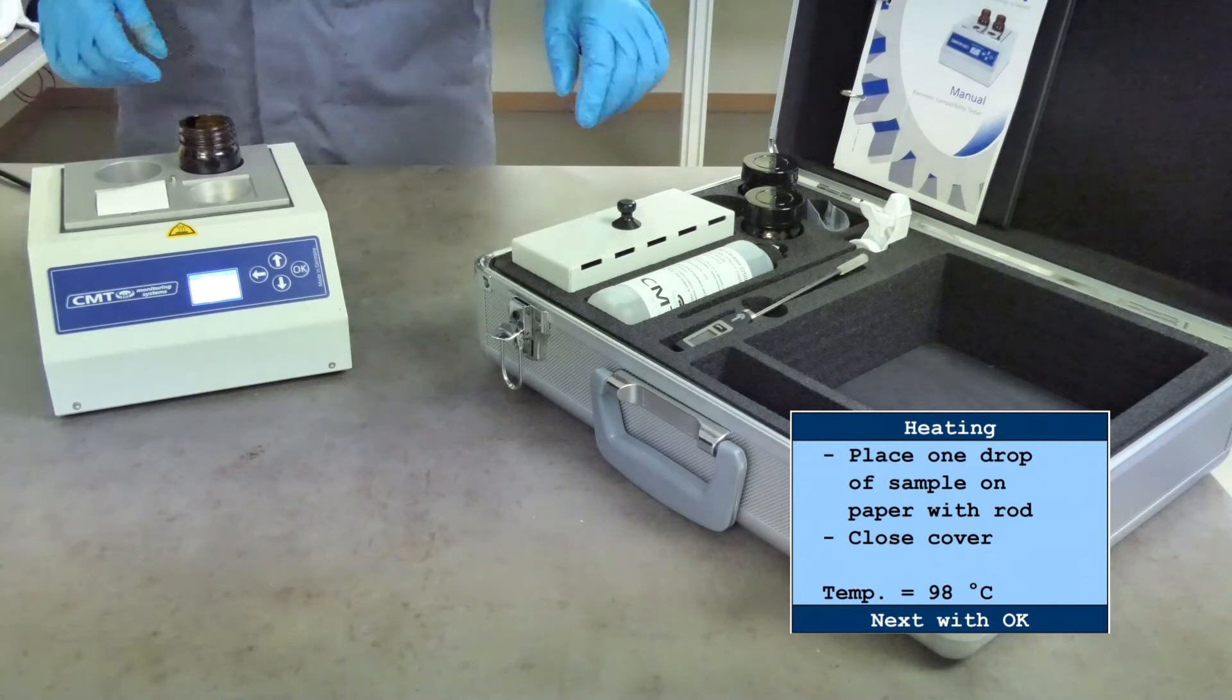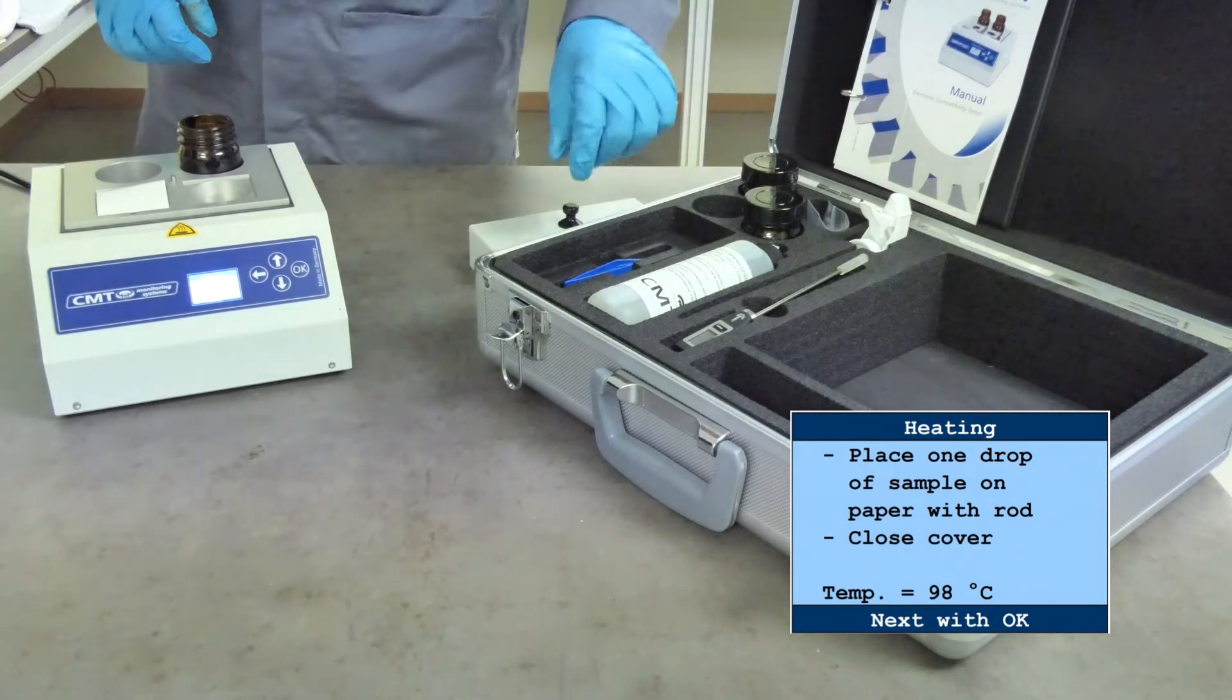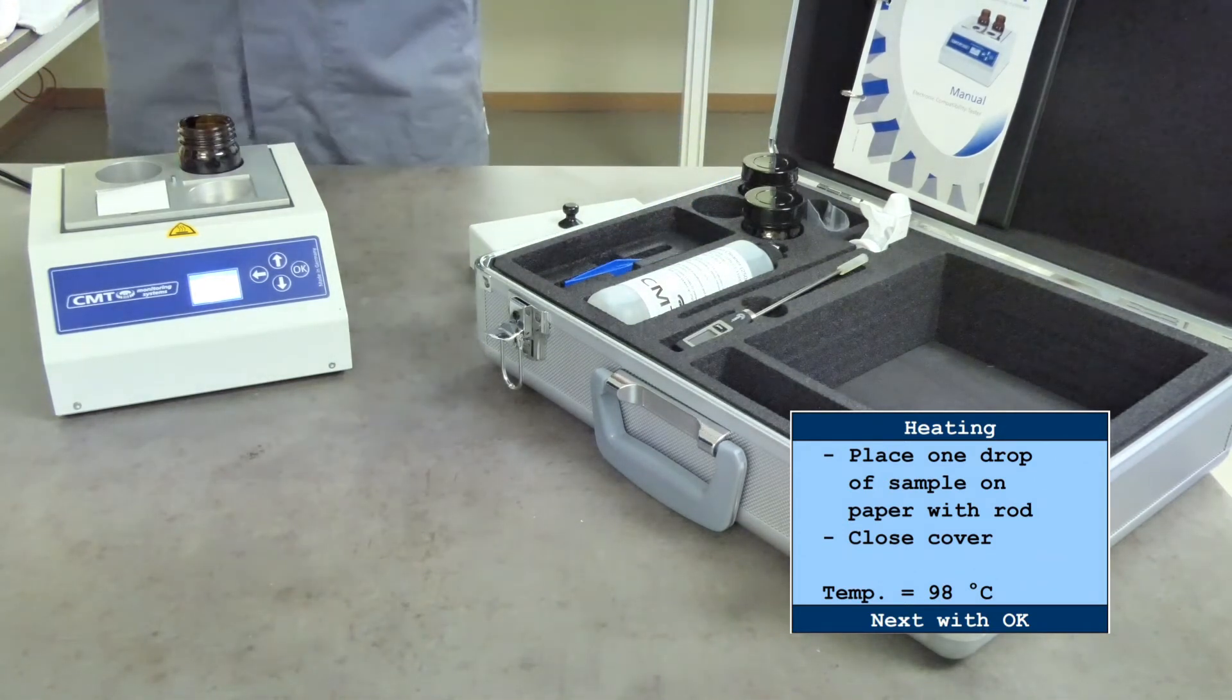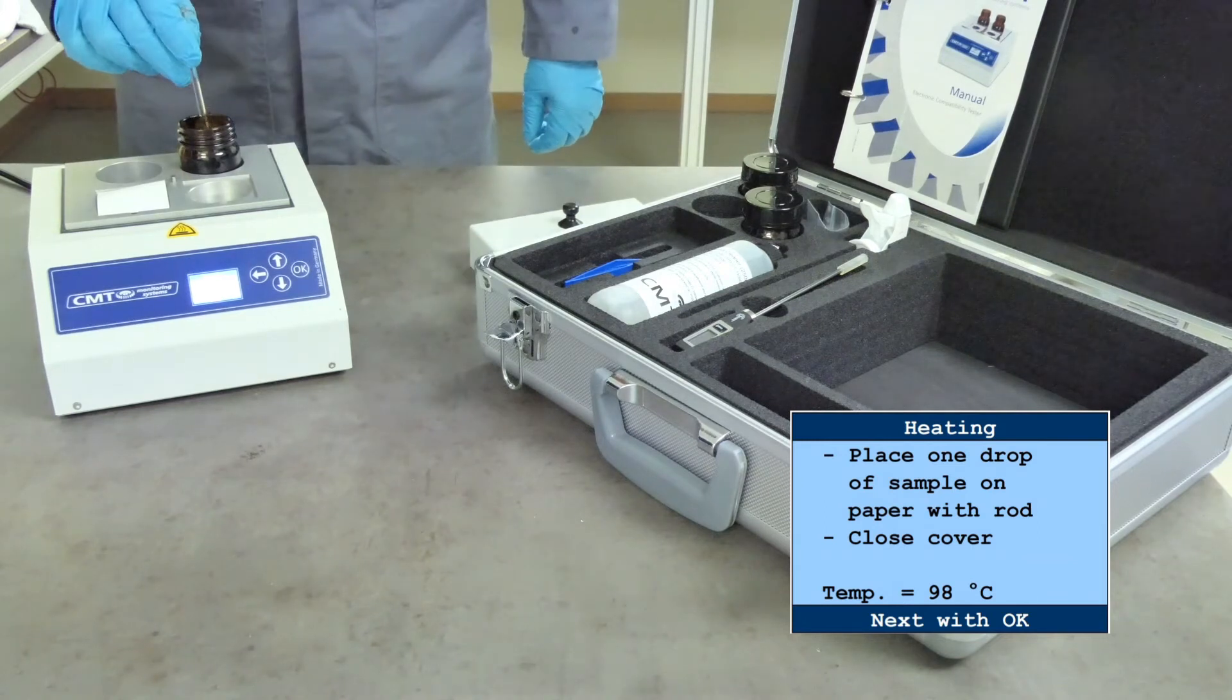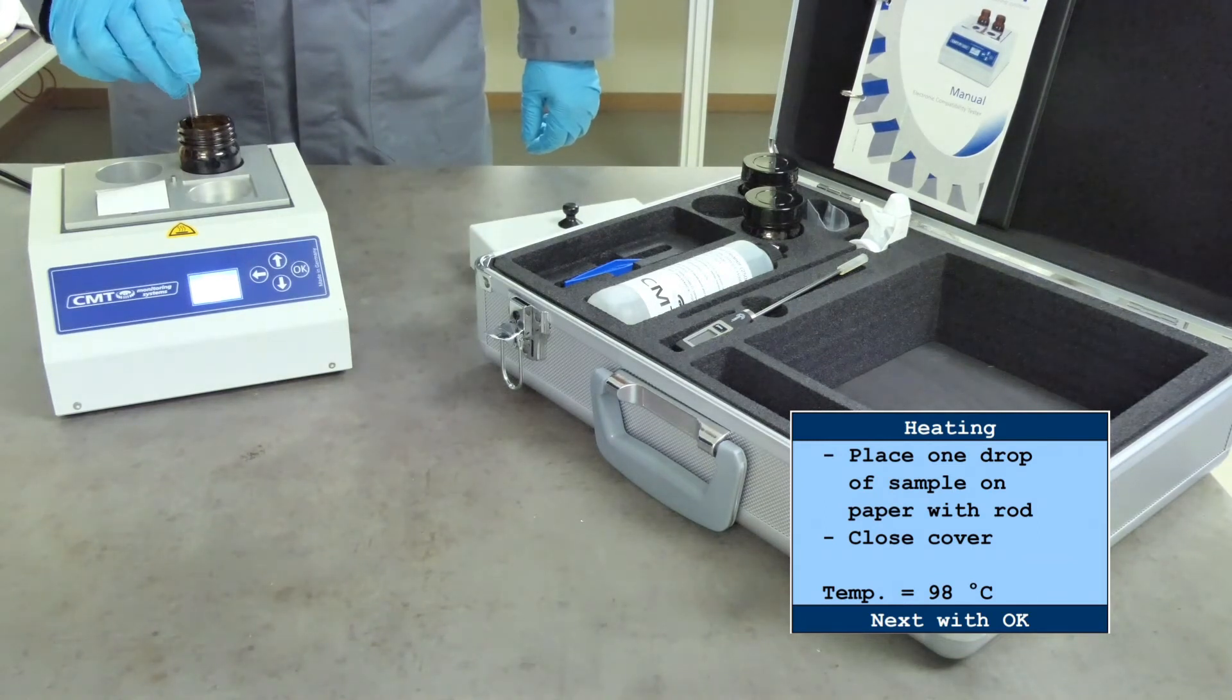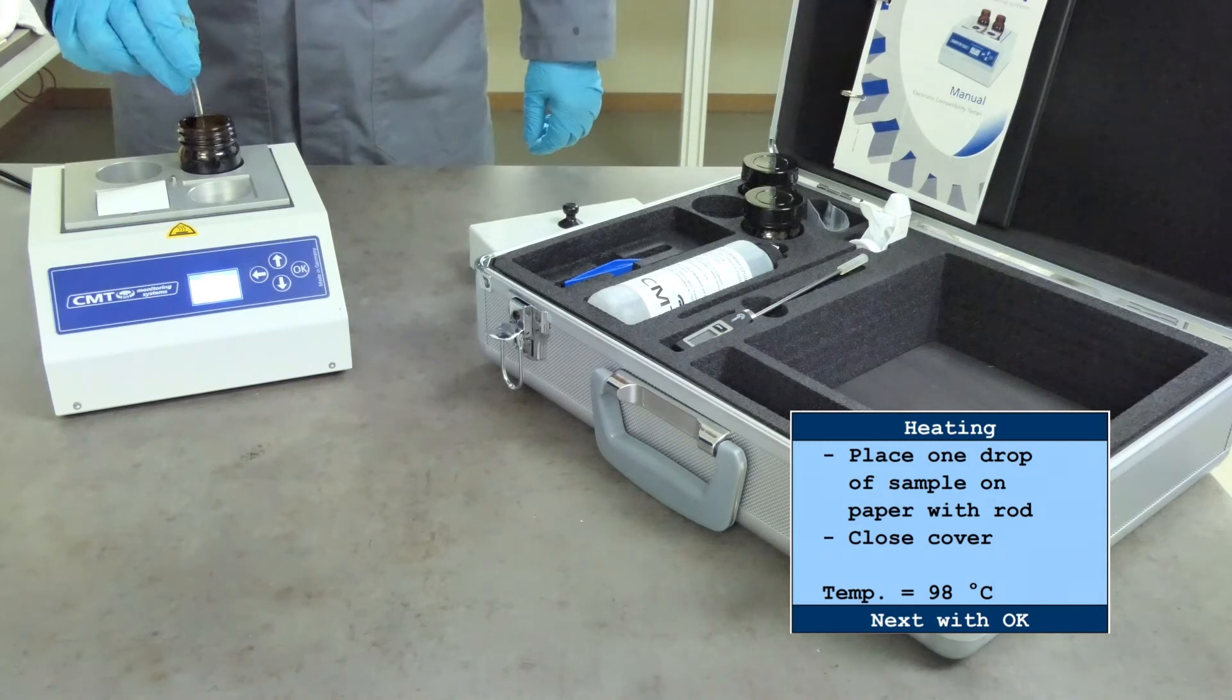After 15 minutes, take one of the glass rods provided. Preheat the glass rod by dipping it in and stirring the heated sample for about 20 seconds.